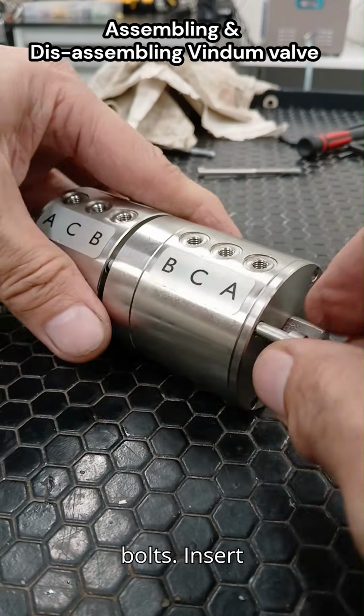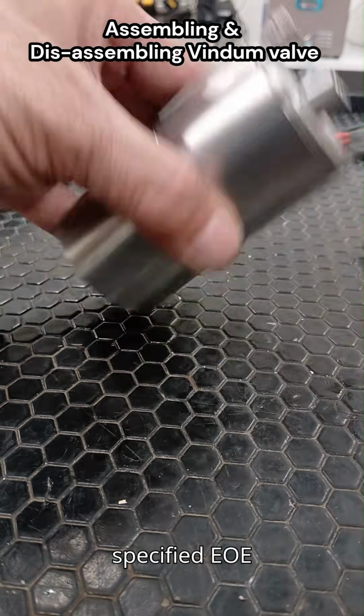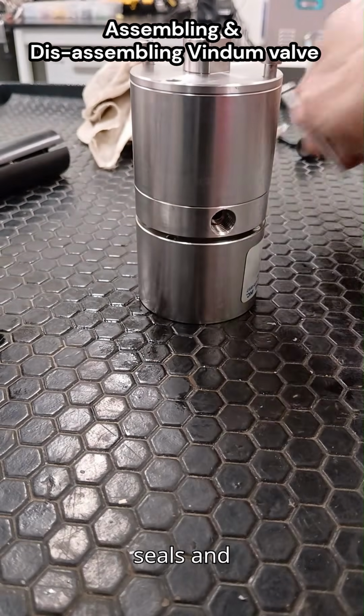Tighten retaining bolts. Insert bolts and tighten in a crisscross pattern to avoid uneven compression. Use the torque value specified by Vindum engineering, important for high-pressure sealing. Do not over-tighten, it can crush seals and scratch faces.